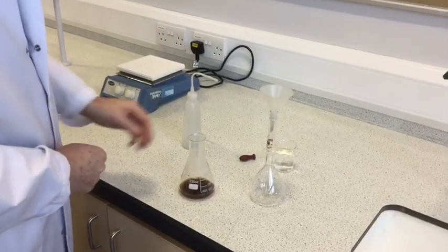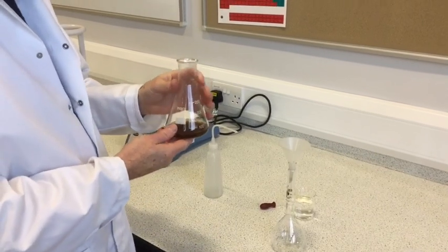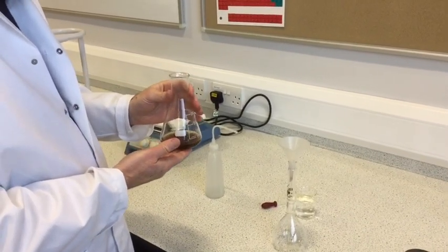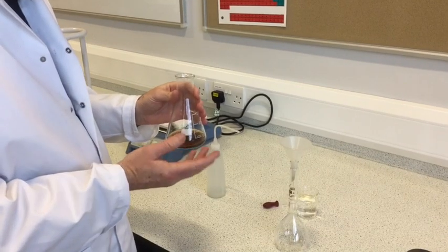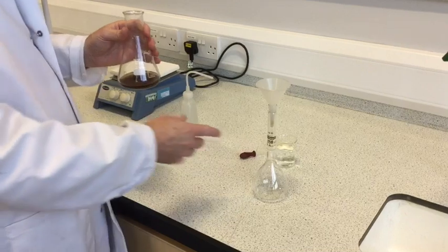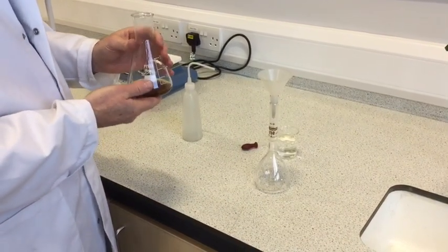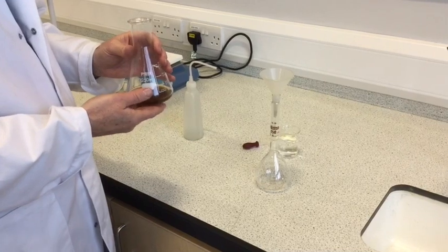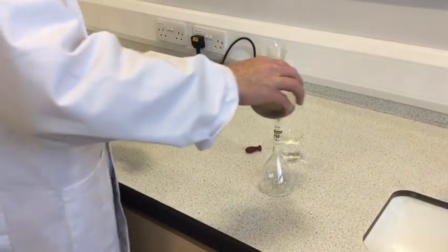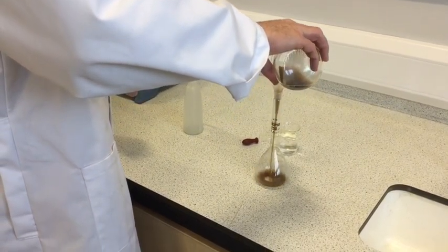Right, we've let the reaction mixture cool down. The reason why we let it cool down, of course, is that aqueous solutions expand when they're hot. So, the standard flask relies on aqueous solution being at around about 20 degrees centigrade. So, that's why we let it cool down. So, we'll transfer this to a 250 cubic centimeter standard flask.